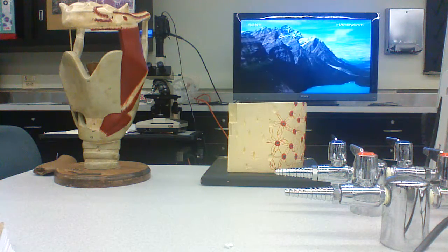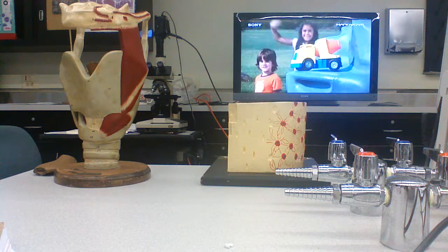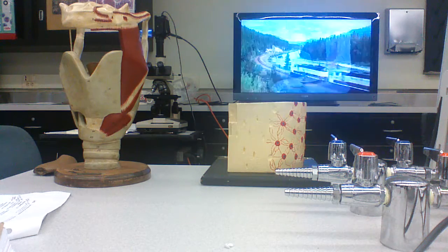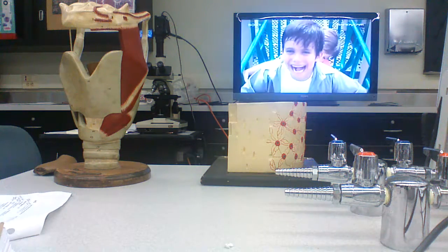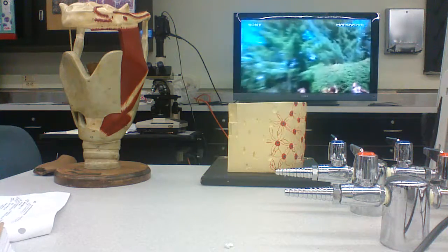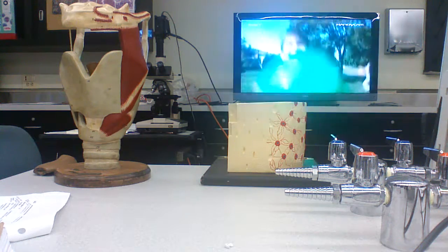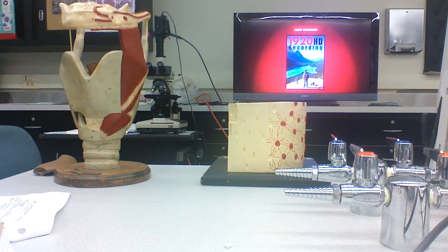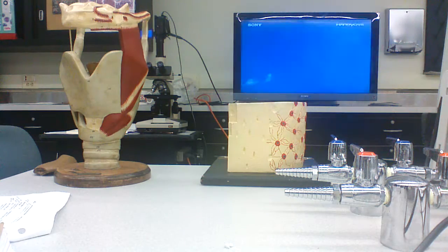And what you're going to have in this region is a zone of cartilage. It's growing here appositionally, as these chondrogenic cells divide, and you're moving this way. Then there's going to be zones of proliferation, hypertrophication, calcification, and erosion.